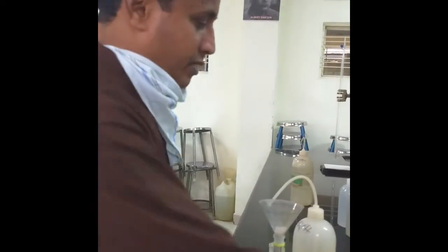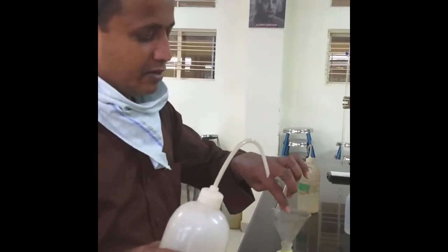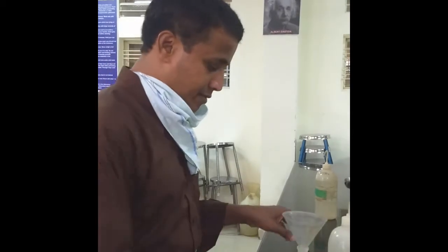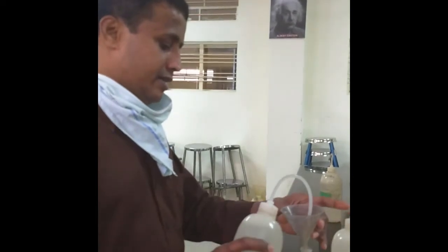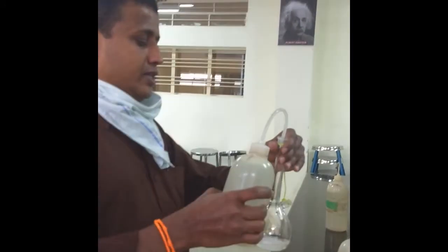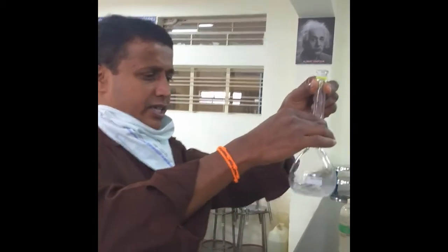Now after addition of this, we need to add one test tube of ammonia — as you have observed in the first experiment on total hardness of a given sample of hard water. You need to add one test tube of ammonia and a little distilled water. Then add slowly with constant shaking in order to make the crystals completely dissolved.